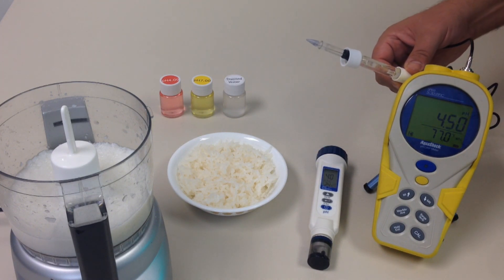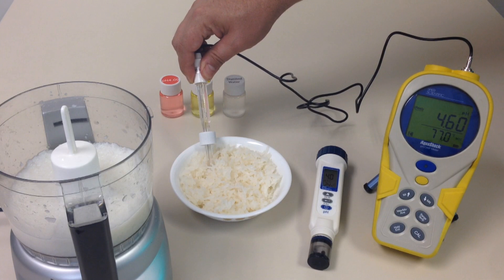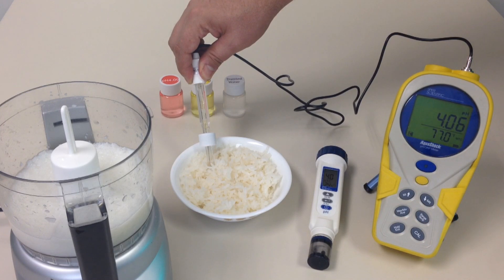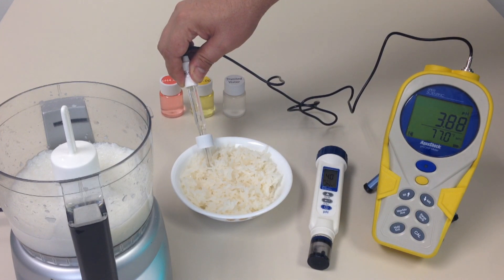To show you how easy it is to use a spear-tip probe, all I'm going to be doing is sticking it into your rice. Most sushi restaurants in states that require this would check almost every batch and keep a log of it. As you can see, this rice is right around 3.8 to 3.9 for this particular batch.